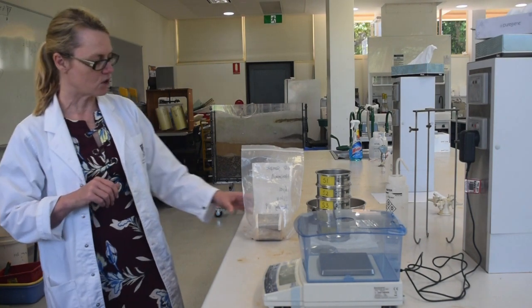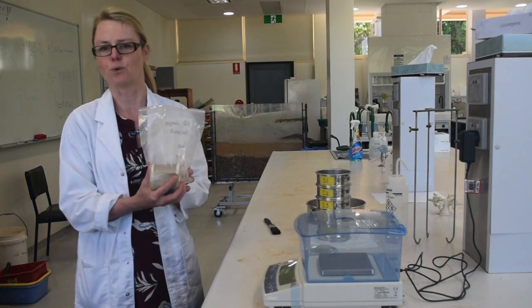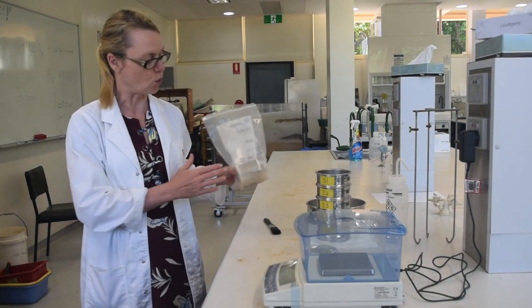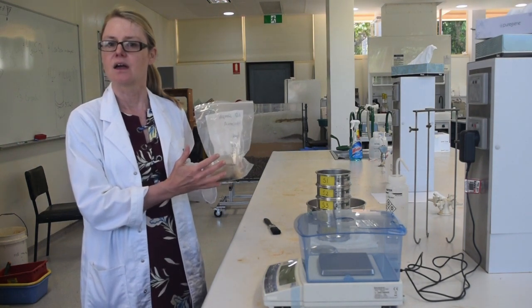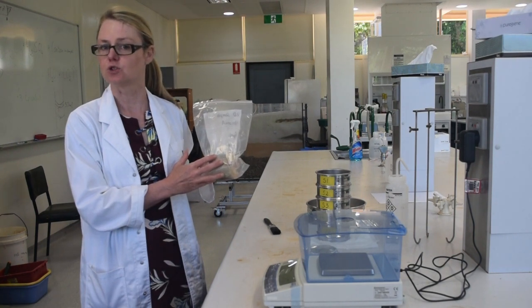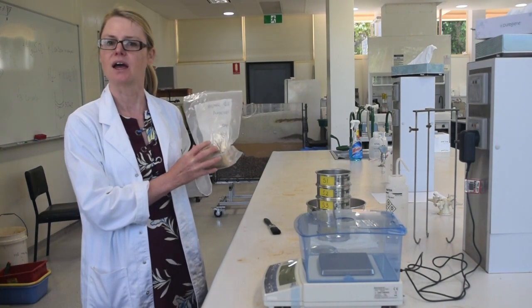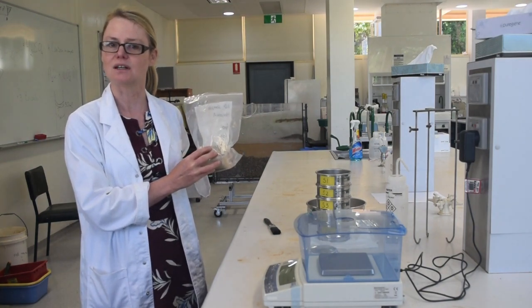Throughout this lab, you're going to be using your bulk density sample that you collected when you were out at Northern. The first thing you're going to have to do is weigh this core with the plastic bag and any masking tape, before you commence measuring anything to do with aggregate stability. So first, determine the weight of this core and the soil that's in it. Instructions on how to do this are provided in the lab manual.